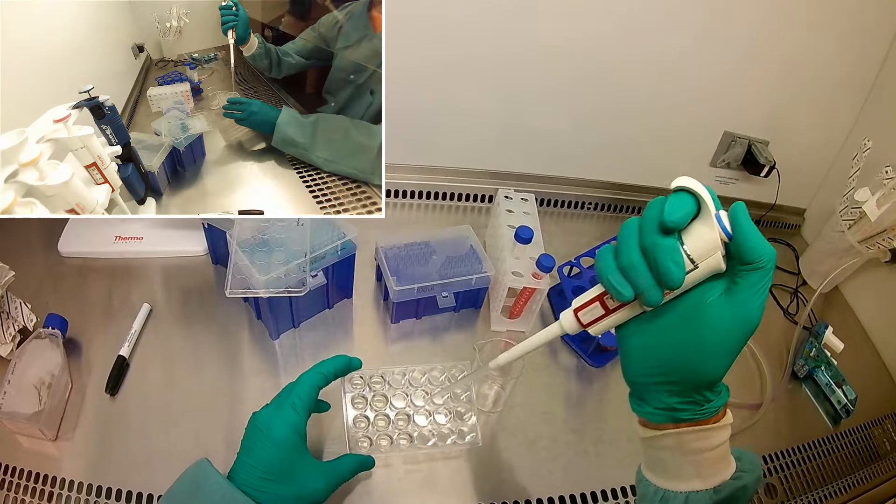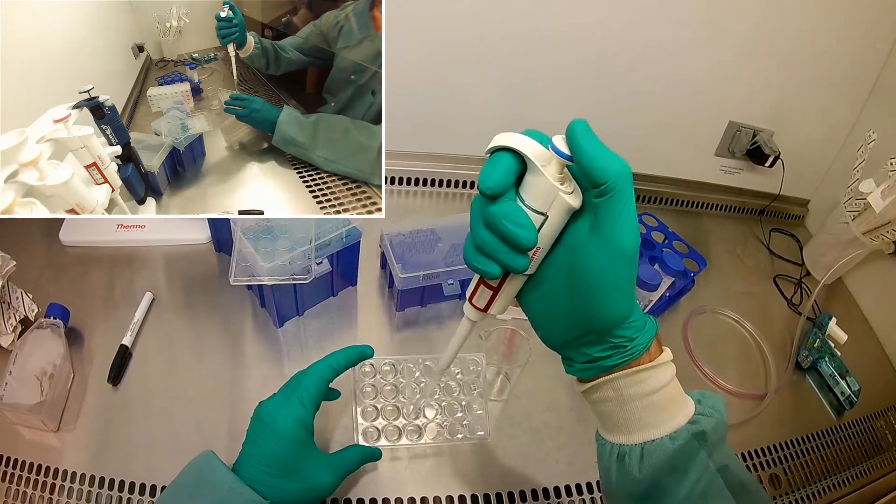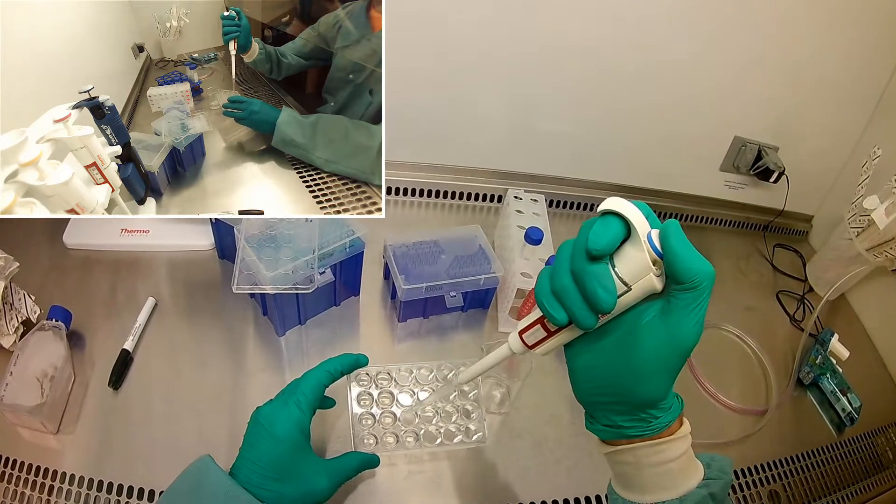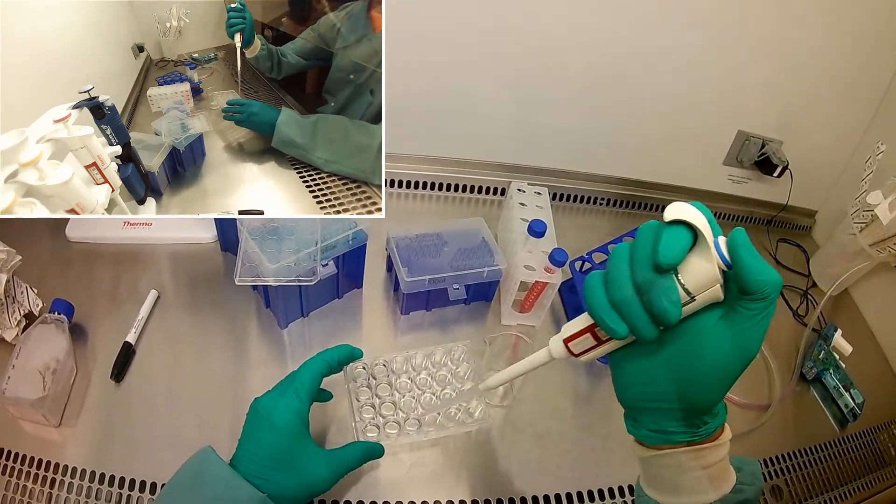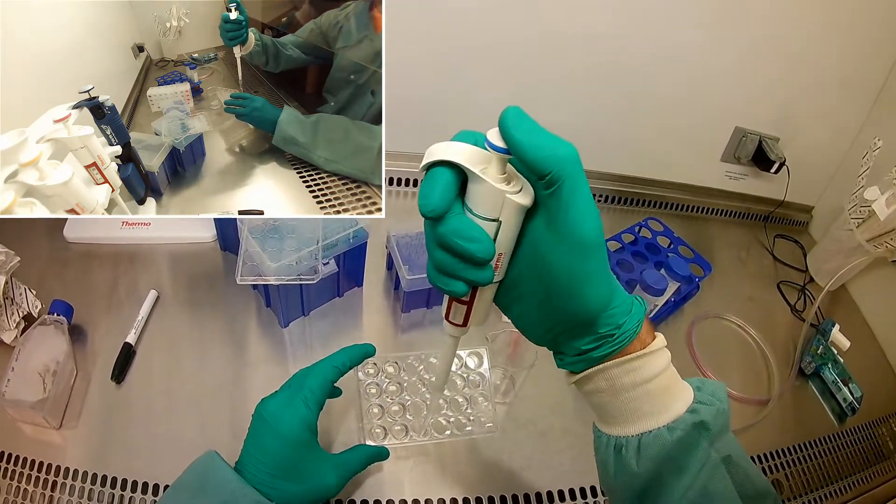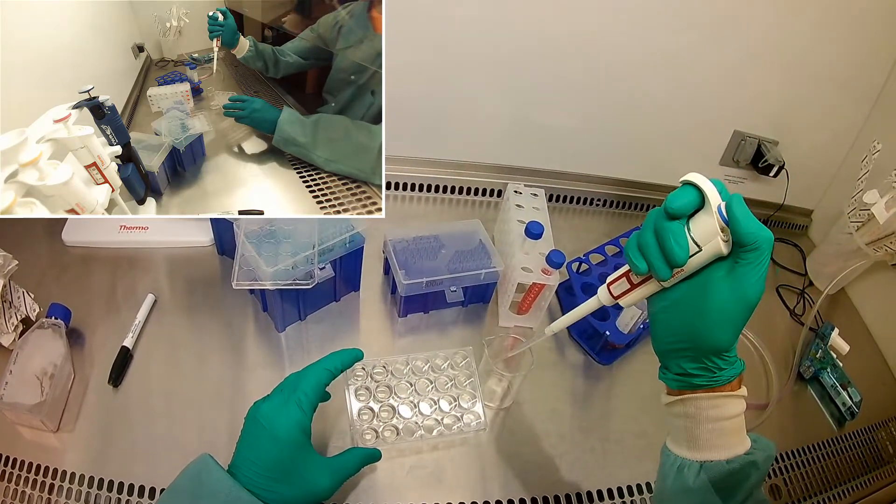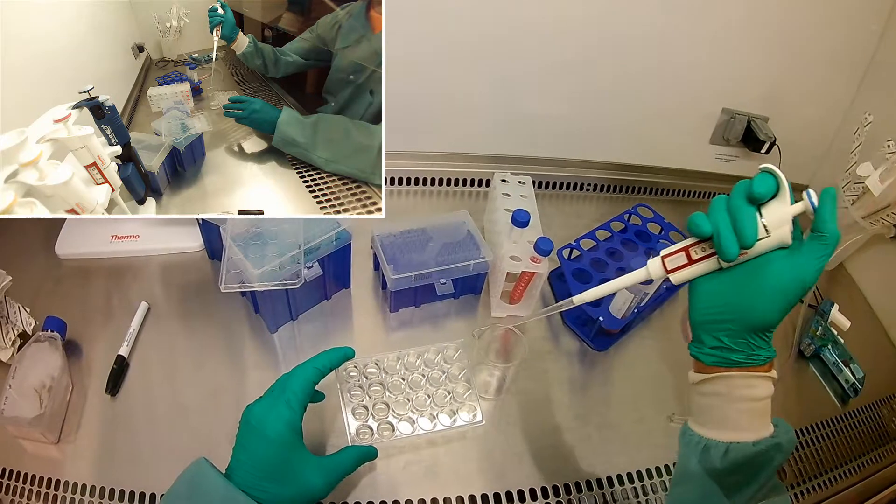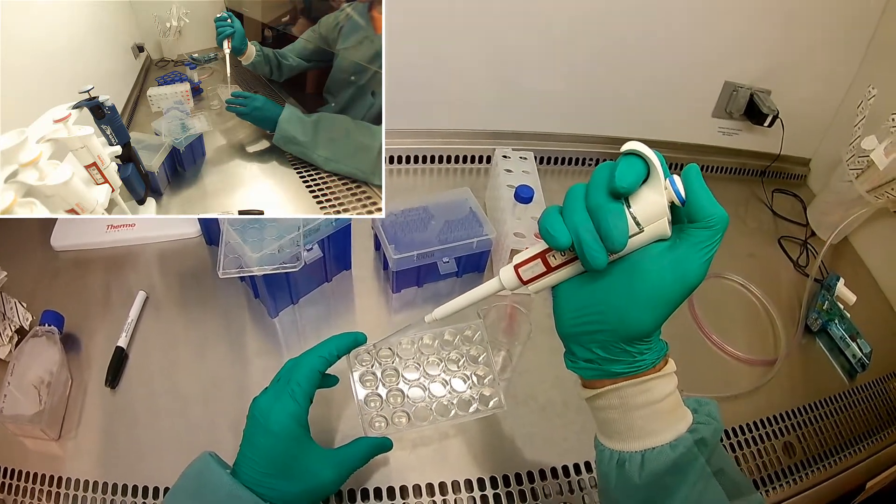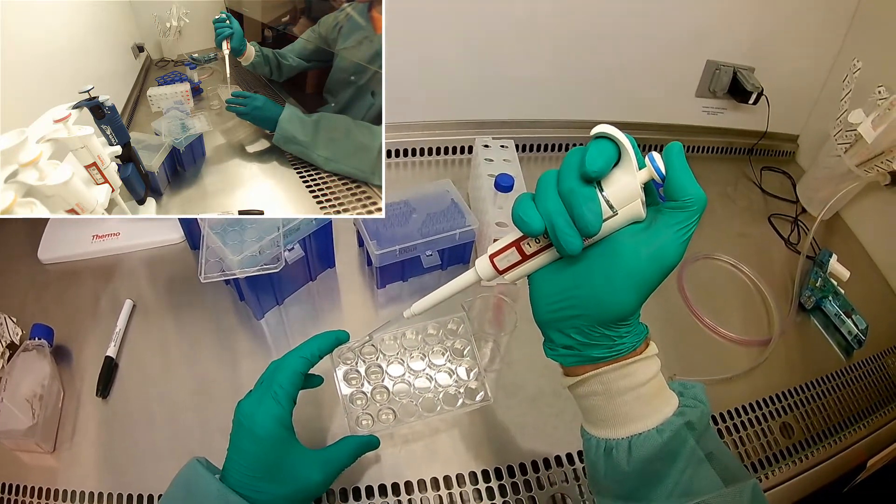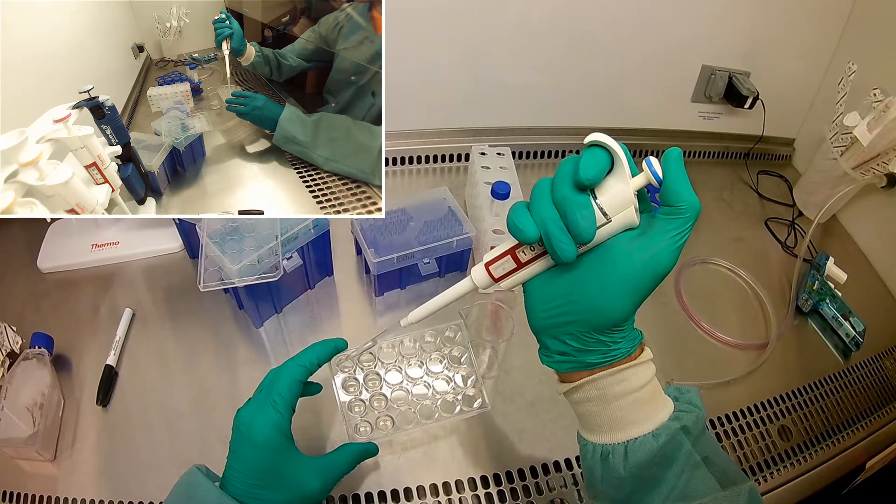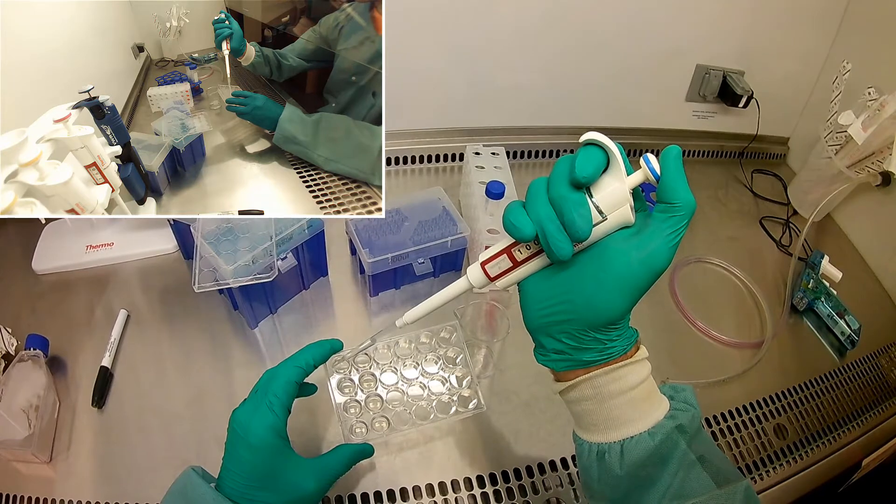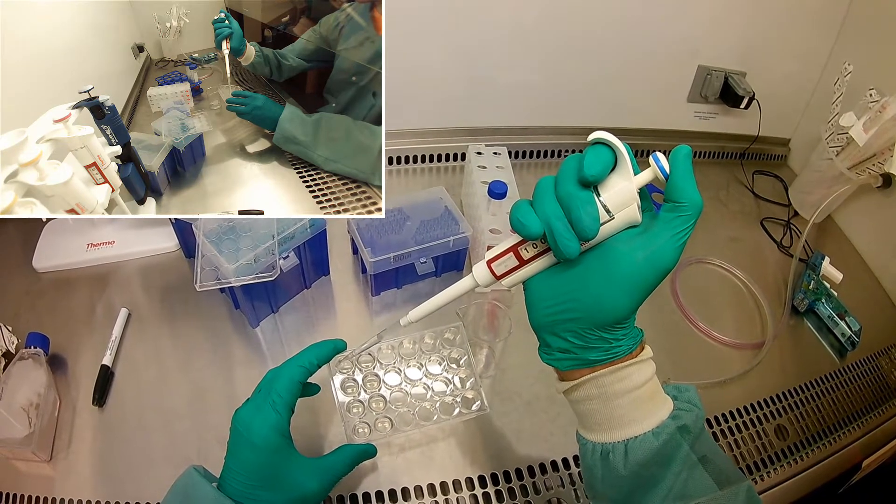I do want to get as much liquid off as I can. Remember when I put the PBS on here, I didn't perfectly measure out one mil. Sometimes it might have been less, sometimes it might have been more. So I'm going to do my best just to suck up one mil, and I might have to go back a second time if necessary. So I'm going to start by sucking from the top, not sucking where the gel is. Go very slow.